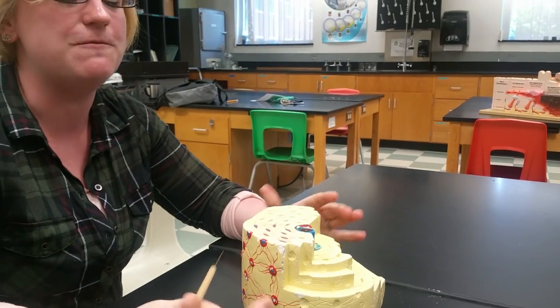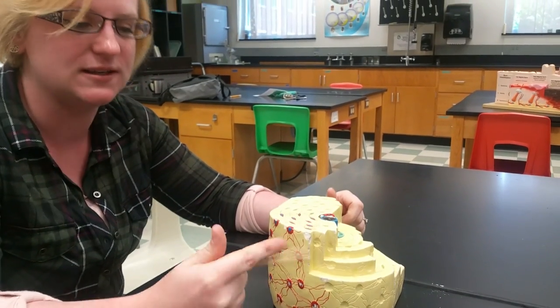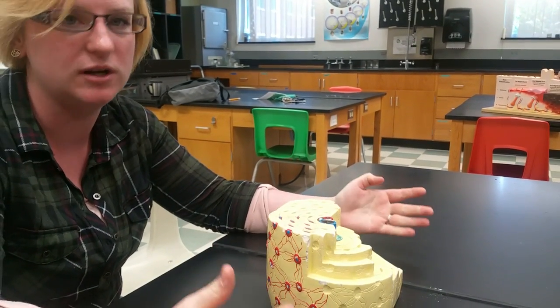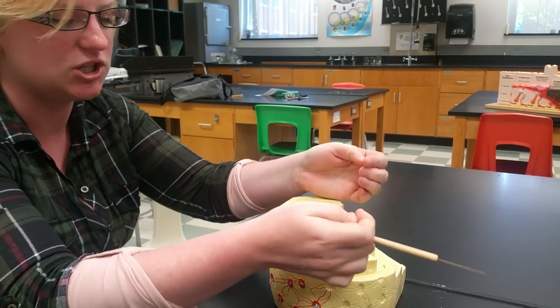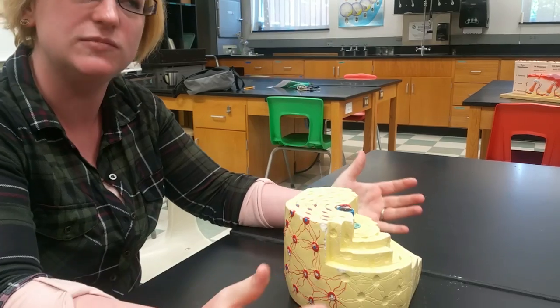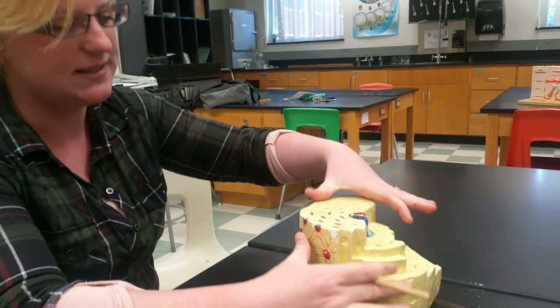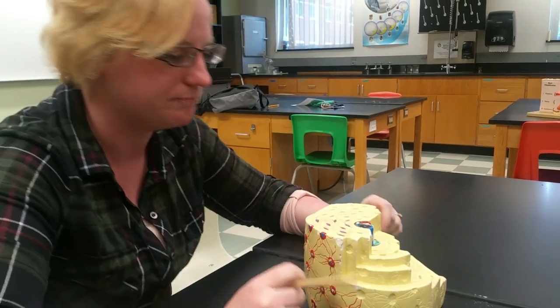So the osteon is the functional unit of bone. So it's not an individual cell, it's not any of that kind of stuff, it's just a functional unit of bone. And whenever you have this concentric shape going on, then you know that we have a strong structure here. Useful when we're talking about bones which support our entire body, right? So this is a model of an osteon, period.